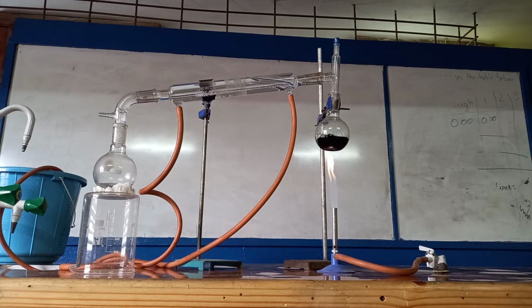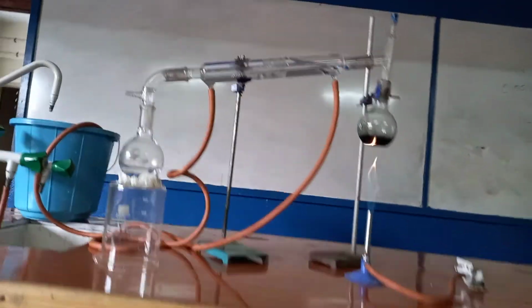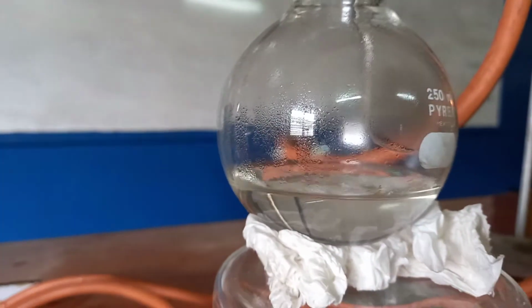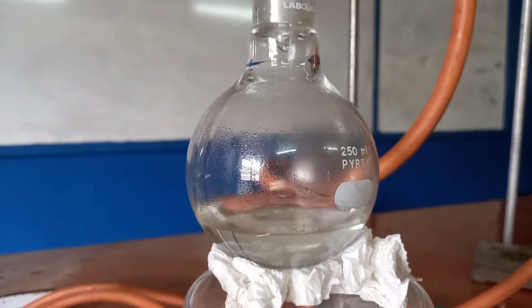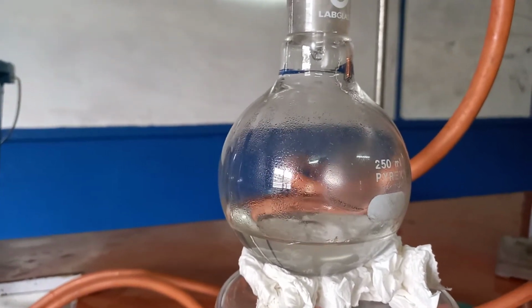And then to prove now that it's actually an aldehyde, we are going to do the silver mirror test again, because we know that that is a test for aldehydes and we can also oxidize it. Alright, so I'm going to stop it there for now. So as you can see, here we have the product. So now in the second part of this video, we are going to test our product with Tollens' solution.